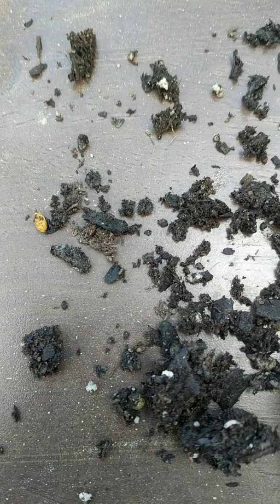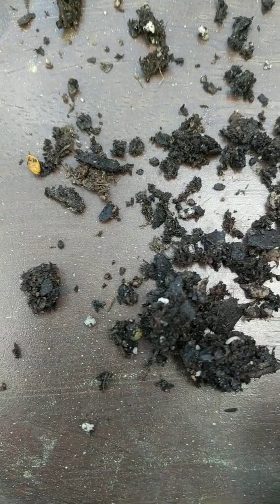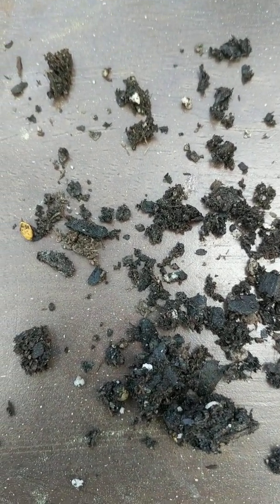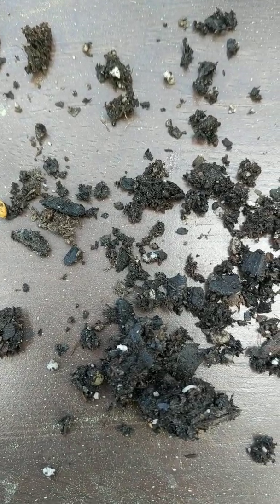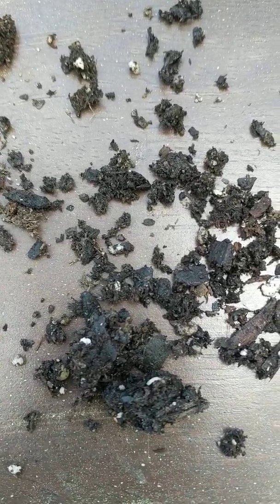Right here there's a little bit of bark and roots. This white right here is from some nutrients that I put in. It's really perlite, and the purpose of that is to allow the soil to have airy spots, so that way water can permeate through. That yellow right there is some fertilizer that's still left over, but we see some tree roots, some fibrous materials from other kinds of roots. The little bitty dots are a little bit of sand and a little bit of silt as well.